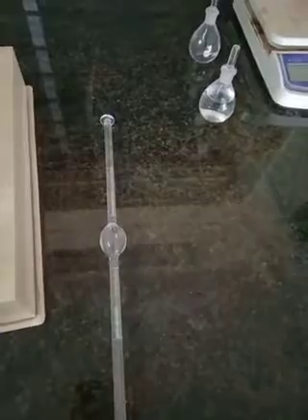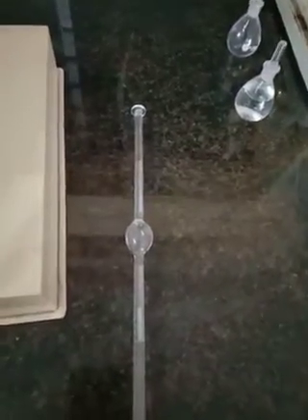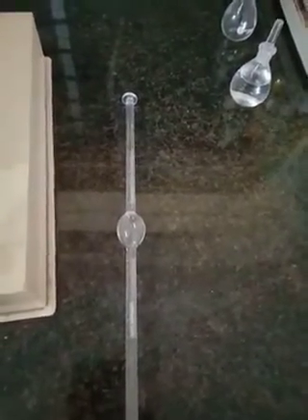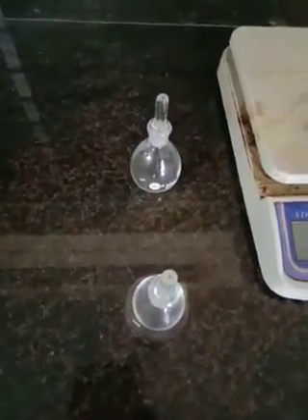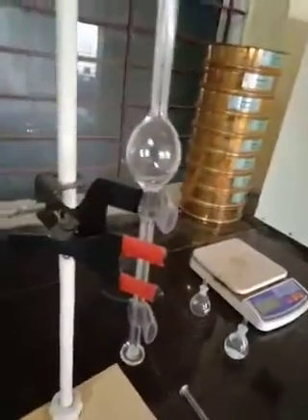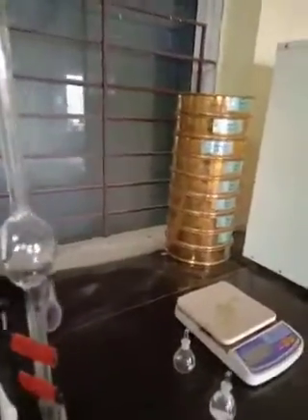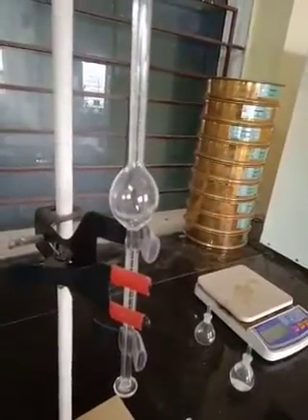We have to prepare the apparatus. First, we take a stalagmometer, then a pycnometer for relative density of water, a weighing balance, and clamp stand. The stalagmometer is placed vertically here.